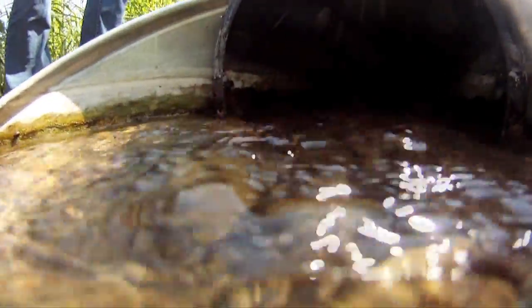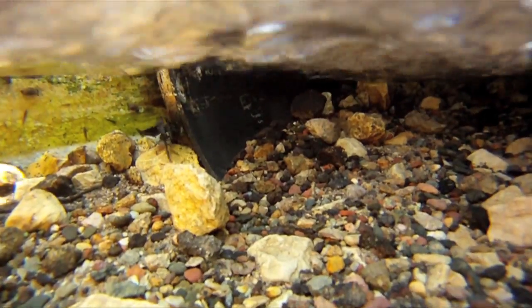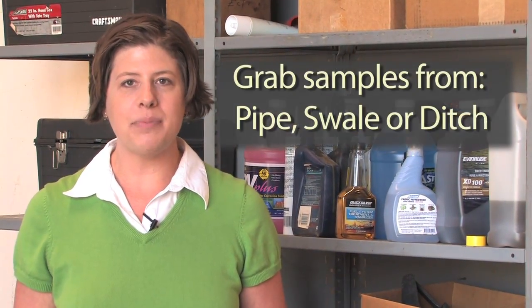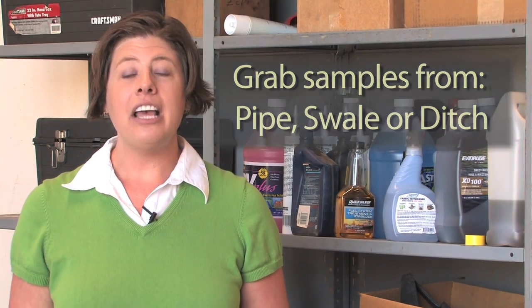A grab sample is a single sample and is as simple as placing a sampling bottle in flowing stormwater. Today I will be collecting a stormwater sample from a culvert. This technique will generally work for the following locations that facilities may be collecting from, as listed on the screen. If you are required to collect a sheet flow sample, be sure to check out our other video, How to Collect a Sheet Flow Sample.